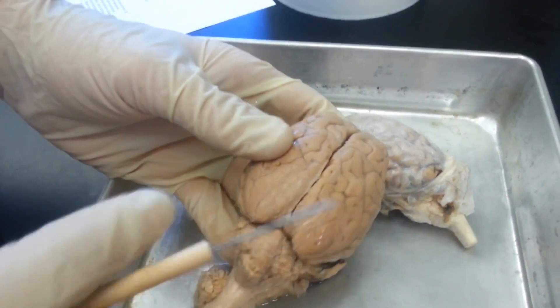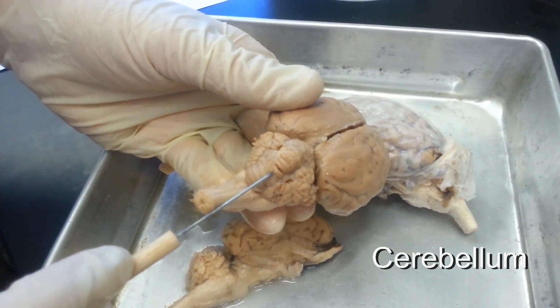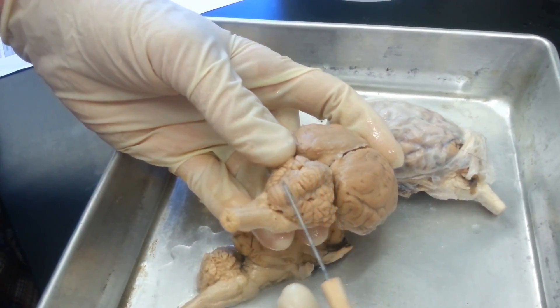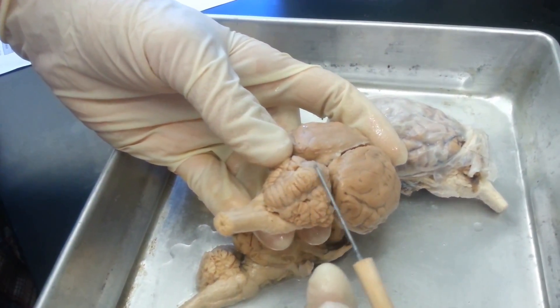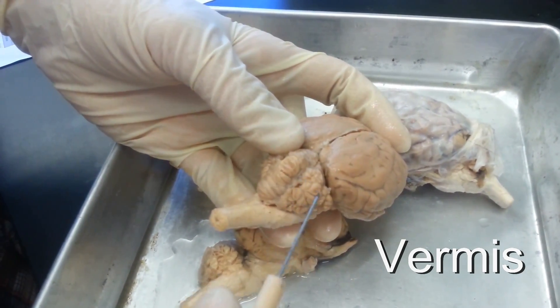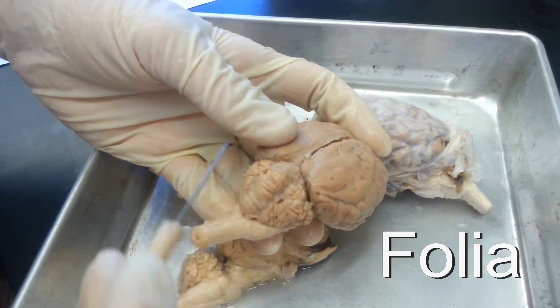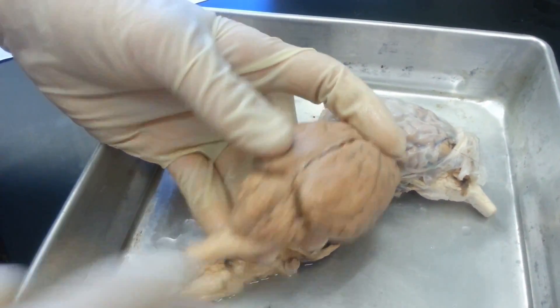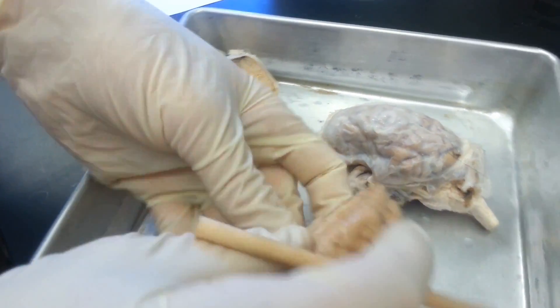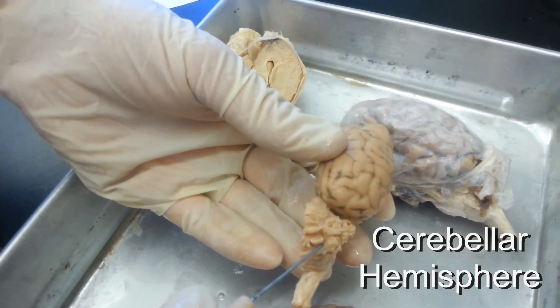Below the cerebrum you have the cerebellum, and it also has regions. The big raised portion in the middle is called the vermis, and then the raised portions on the sides are called the folia. If you split it in half, it also has cerebellar hemispheres — this is the right cerebellar hemisphere.